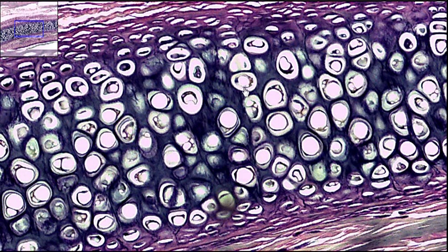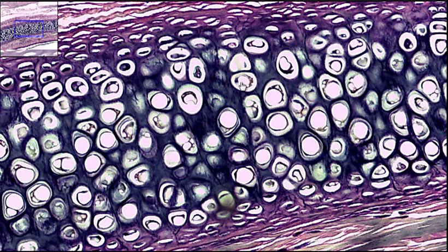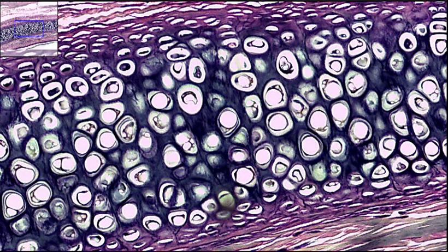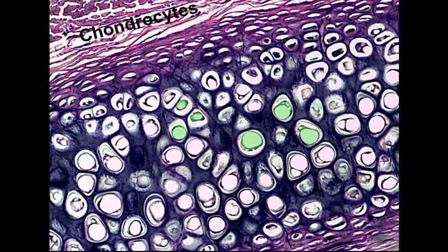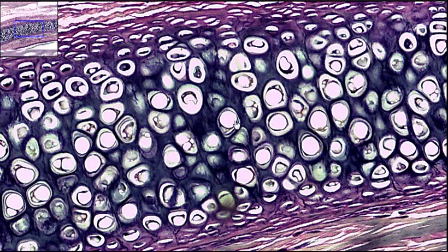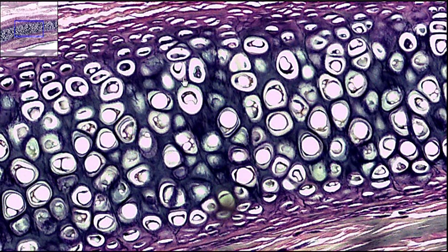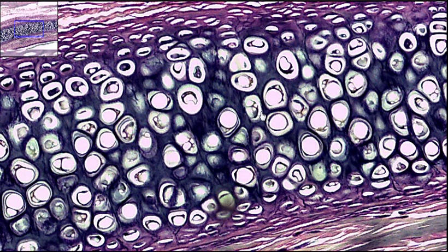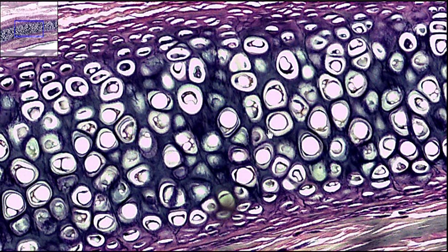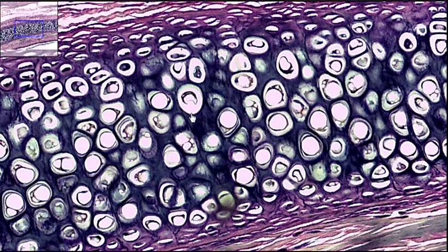We can see the cells, which are the chondrocytes. Here's a chondrocyte, here's one, here's one. These chondrocytes are within lacuna. The lacuna is this outside structure that is housing the cells. So this outside structure is lacuna.